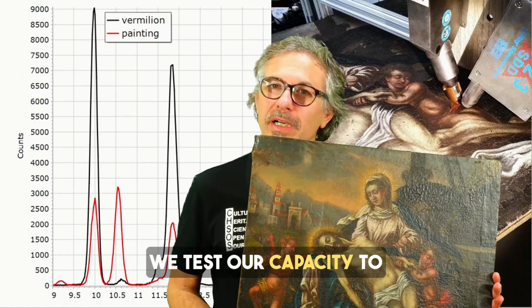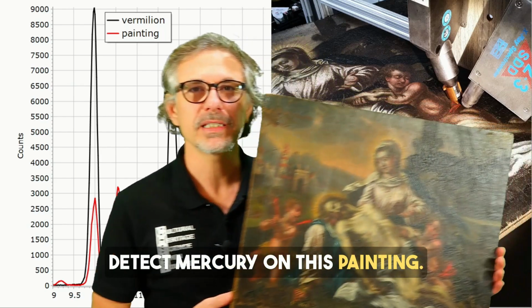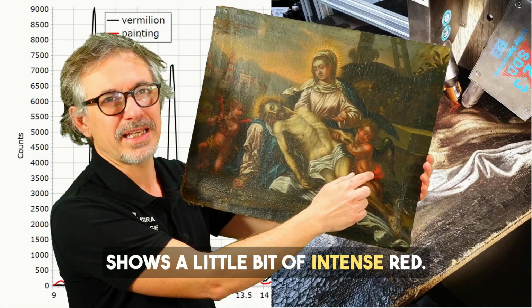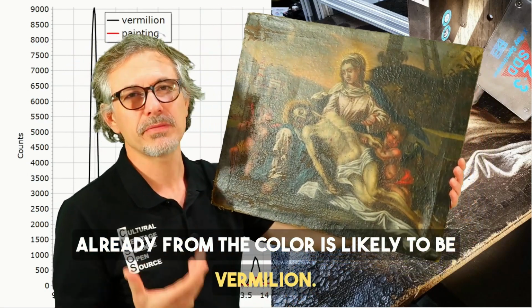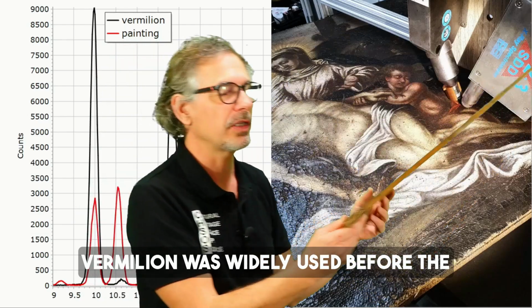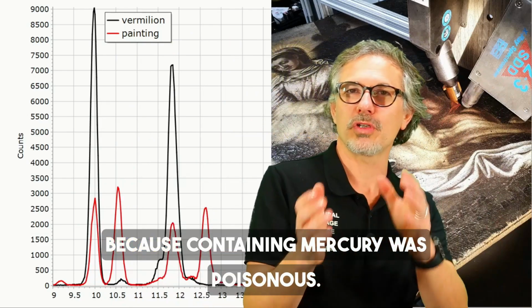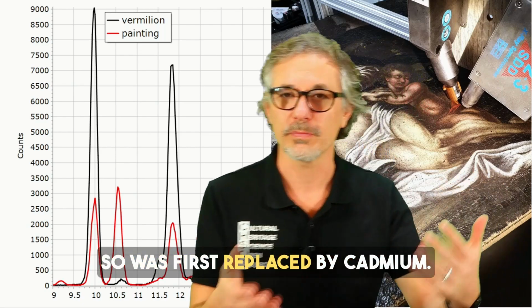We test our capacity to detect mercury on this painting, where the drapery of the angels over here shows a little bit of intense red. Already from the color it is likely to be vermilion. Vermilion was widely used before the discovery of cadmium red, which replaced it because mercury is poisonous, so vermilion was first replaced by cadmium.